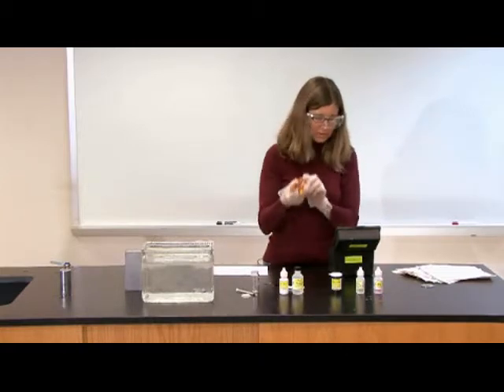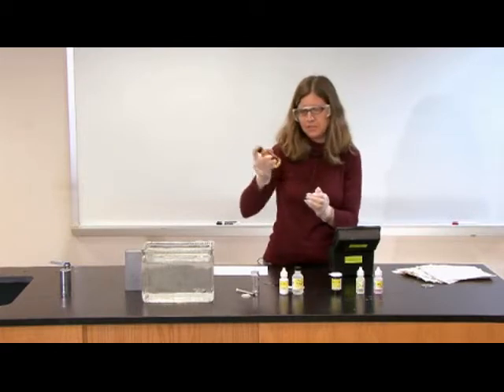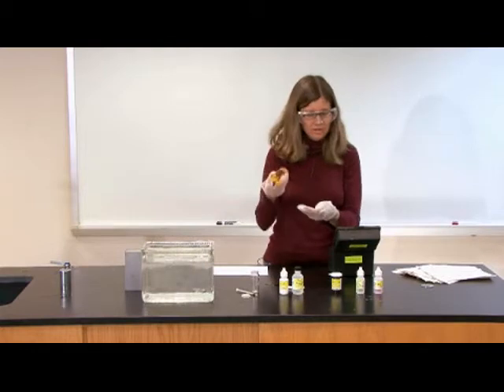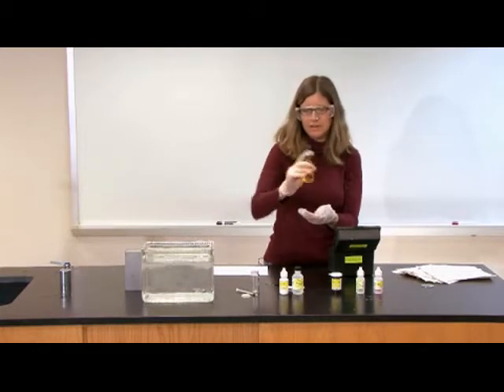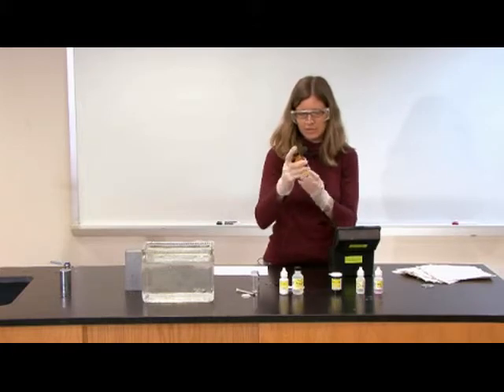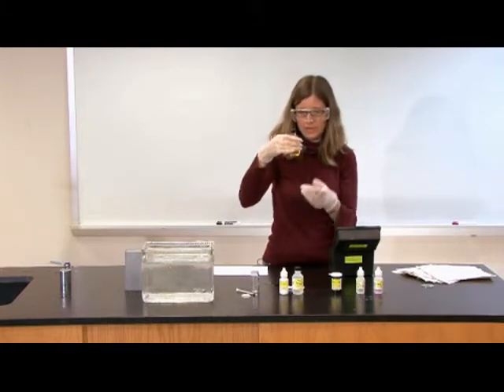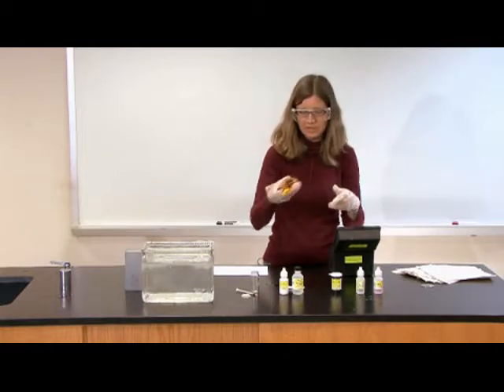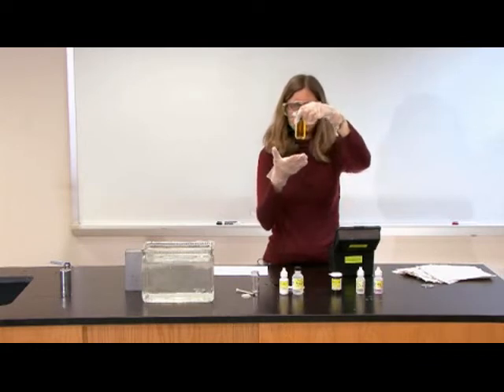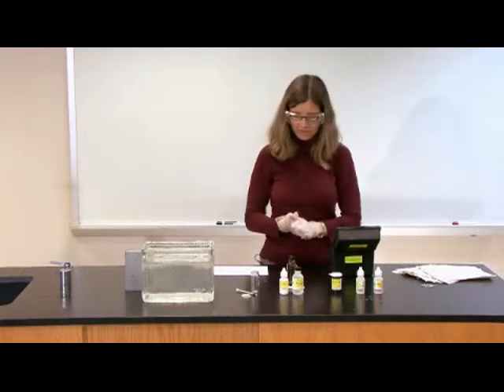Once that powder is dissolved, my sample is now fixed, so I've completed the sample preservation stage, and that means I can wait as long as I want to actually do the test procedure. So this is the part I would need to do right after collecting my sample, but now I can wait several days or so if I need to before I actually measure the amount of dissolved oxygen.